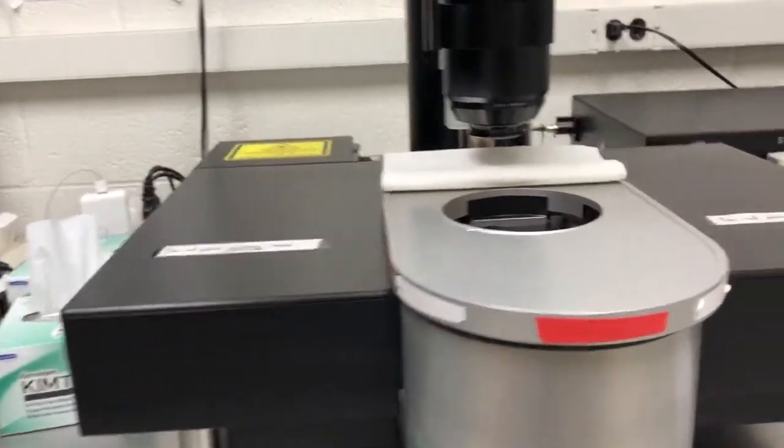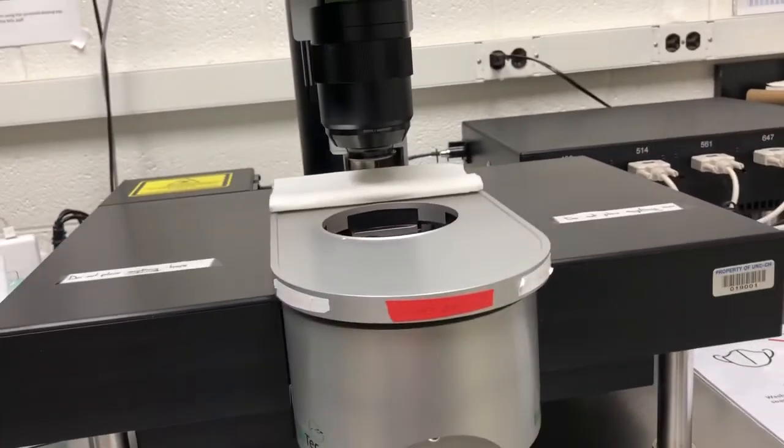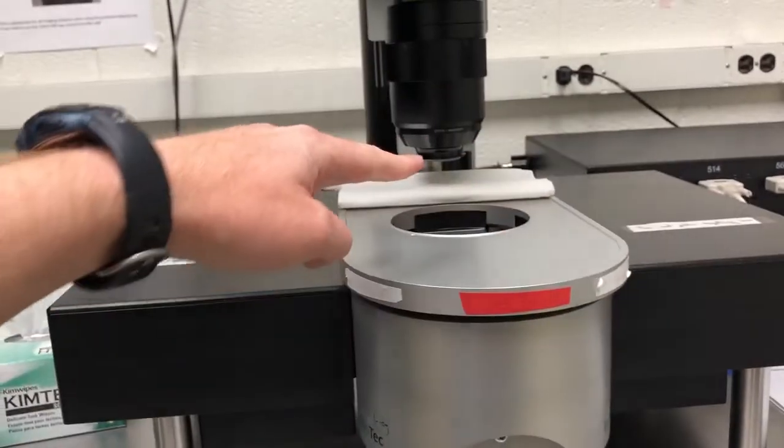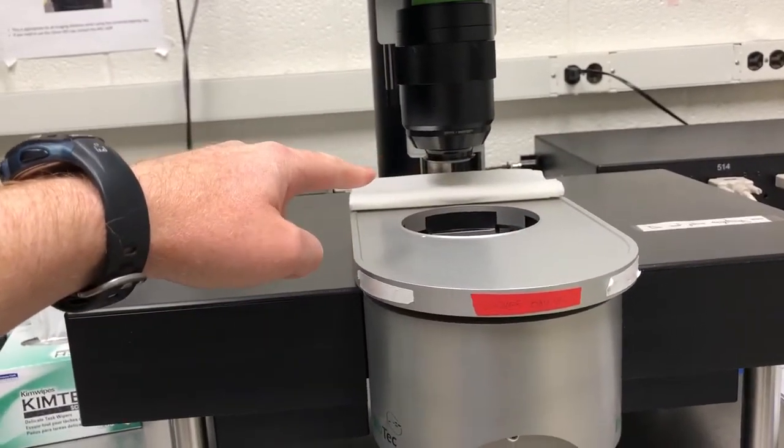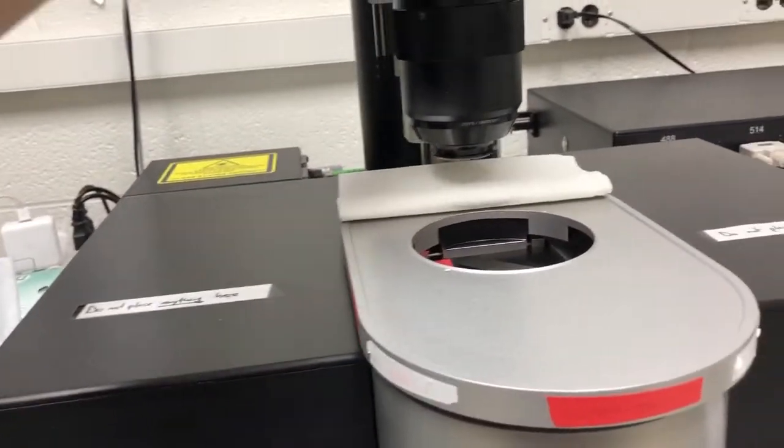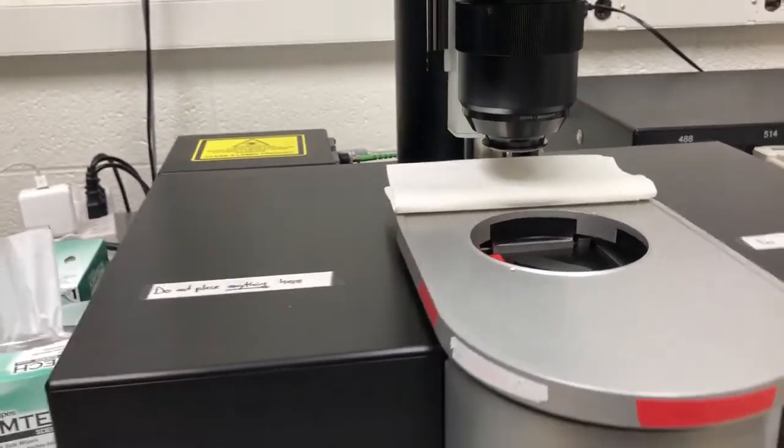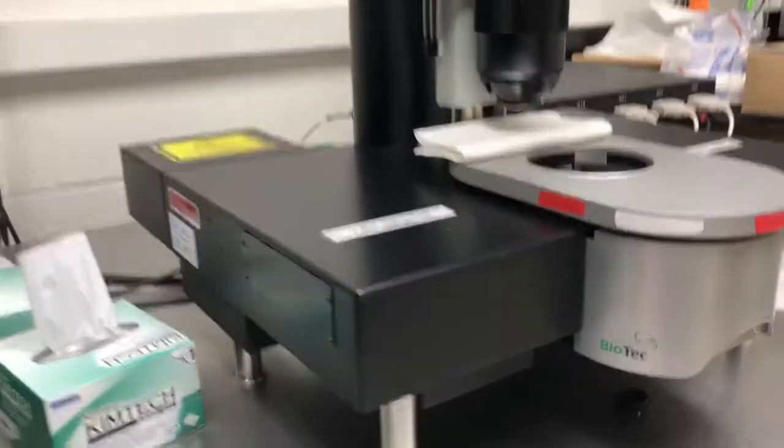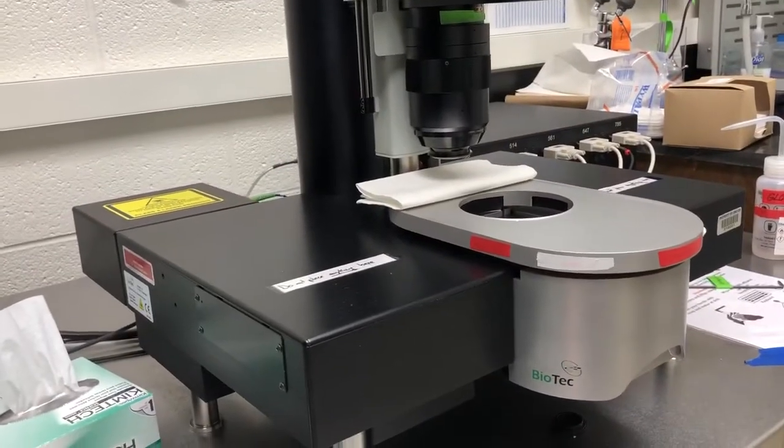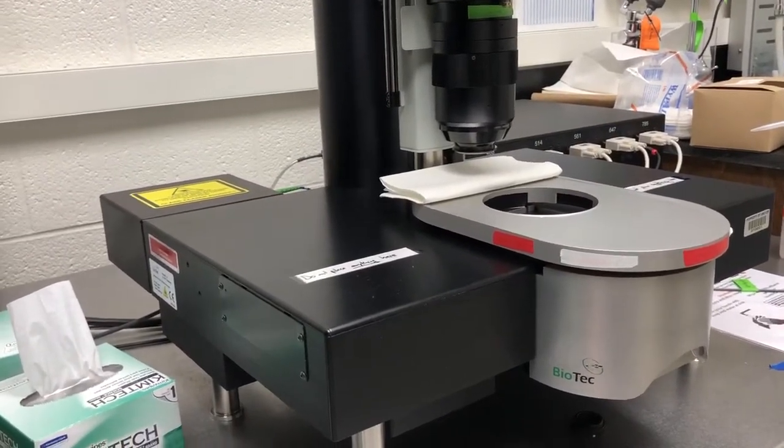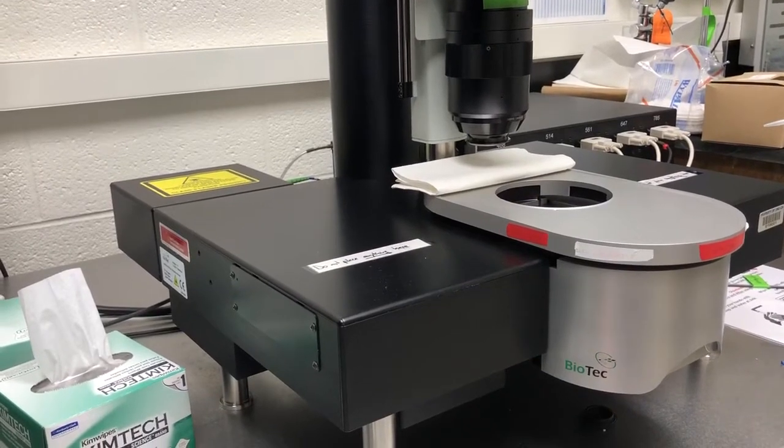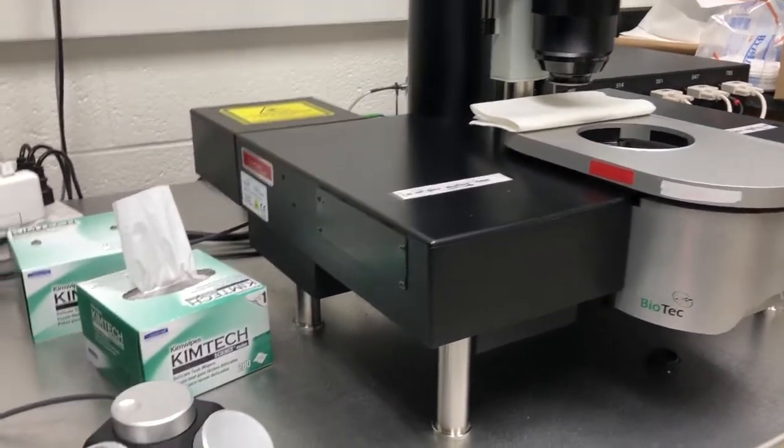There is nothing that would stop you from raising the sample so much that it crashes into the front face of the objective, or lowering the objective so much that it crashes into the sample. There's no mechanical stop that will prevent this from happening. To avoid that, we have a number of procedures. The way we do things minimizes that risk.